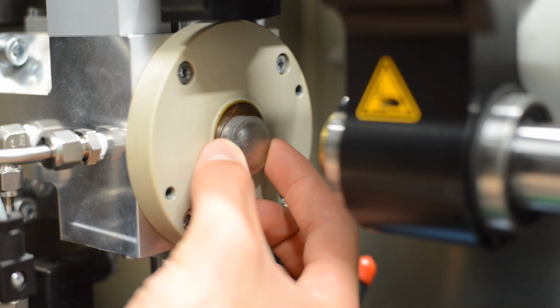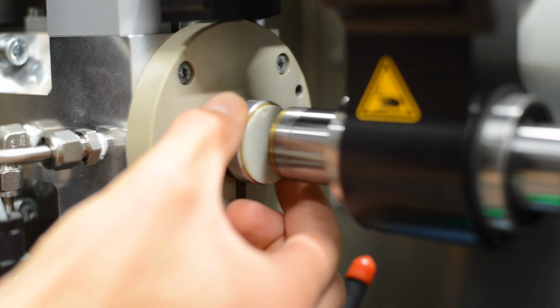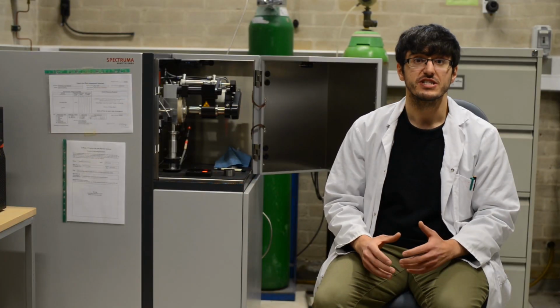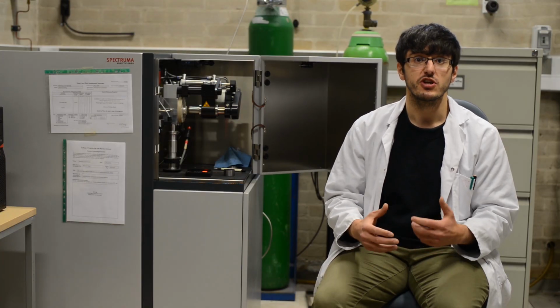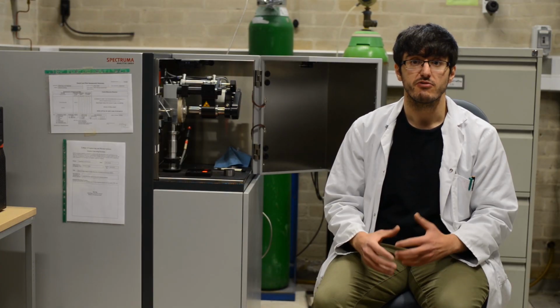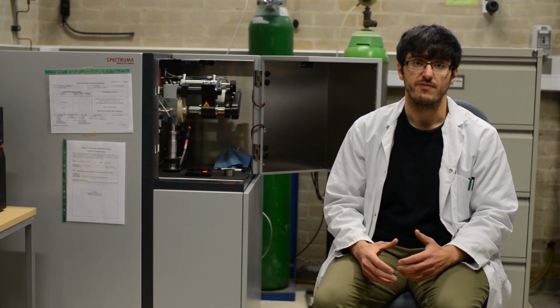When we want to analyze samples, the vacuum pump is started and this rod pushes both the sample and the sample insulator towards the machine. With the help from an O-ring, a seal is created from the outside atmosphere, therefore making pumping down possible. Evacuation is carried out until a desired vacuum is reached, before remaining contaminants from the air are purged by flushing through some argon gas. Once purging is complete, a specific pressure of argon gas is built up in the machine before the power is switched on.